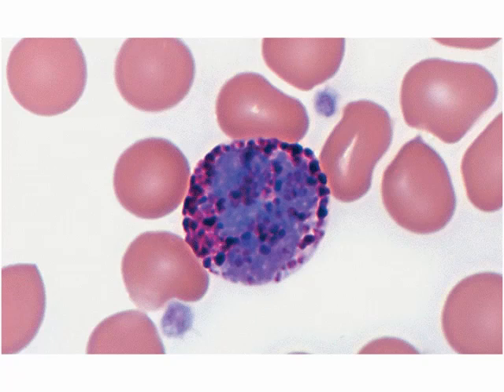All right, this next slide is the white blood cell that is the least abundant. That would be a basophil. Basophil has the very, very dark staining granules. I also see a couple of platelets there. Do you see? There's a platelet. There's a platelet. Platelets are also called thrombocytes. You'll recall that. All right, look at the basophil. Look at all the little granules. These are cytoplasmic granules. And then you see the nucleus, which is the hazier blue color in there. It is lobed because it's like neutrophils and eosinophils in that it has a lobed nucleus.